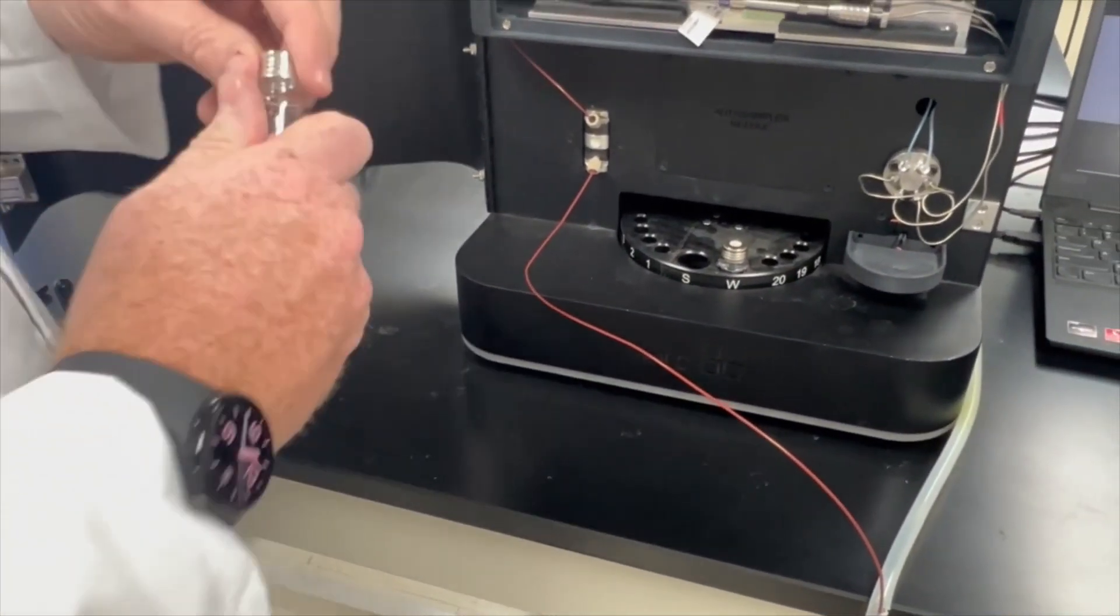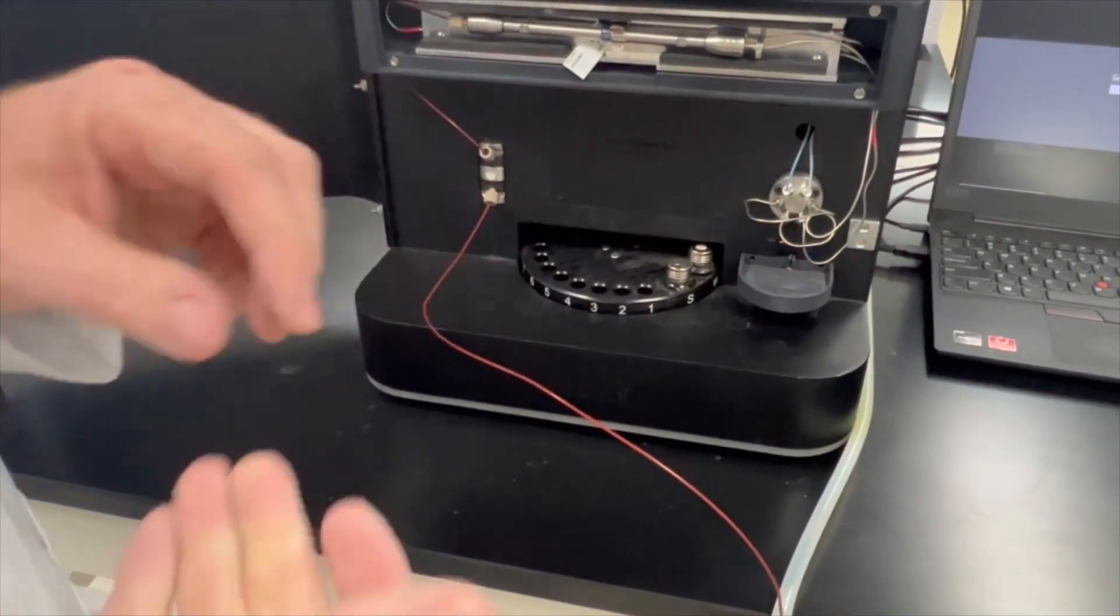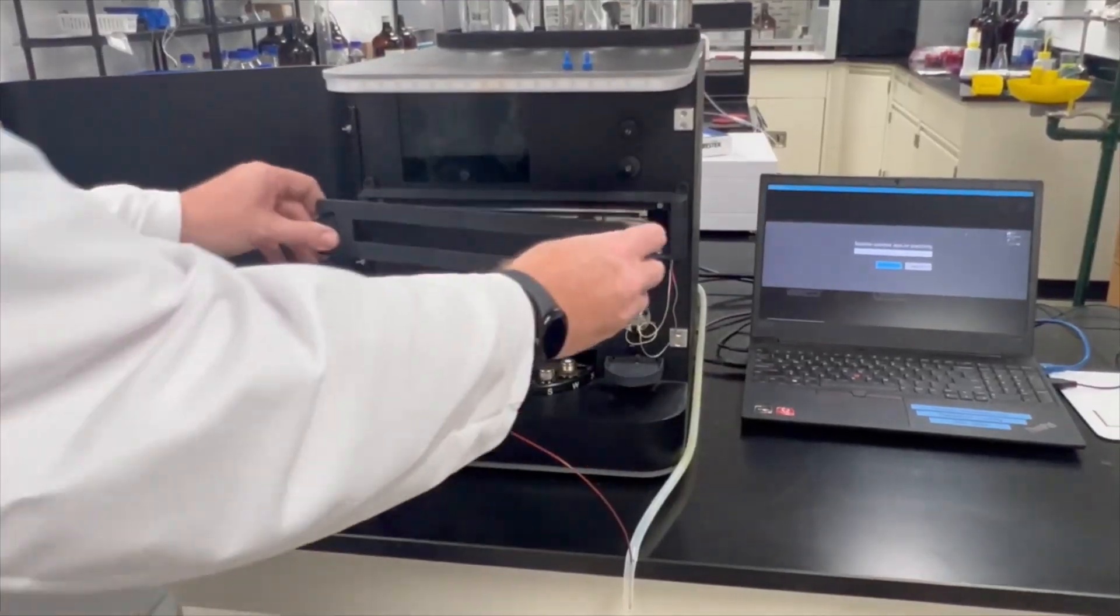Put that on an empty vial. Put that in there. We're going to replace our oven door.